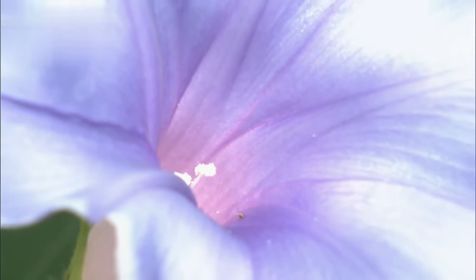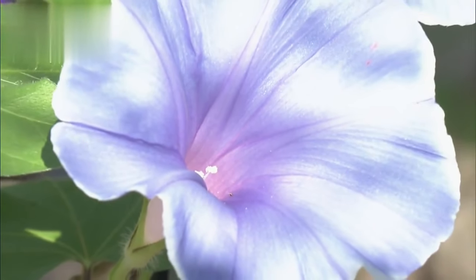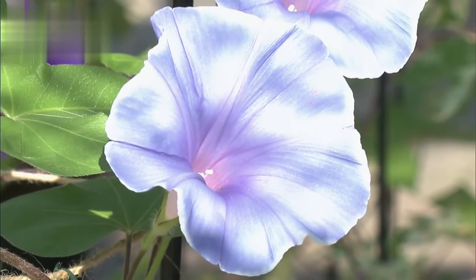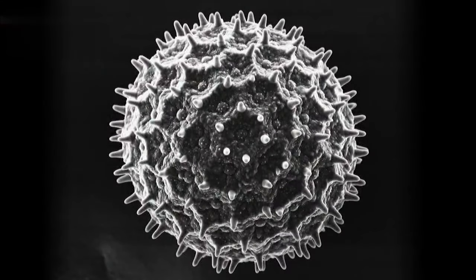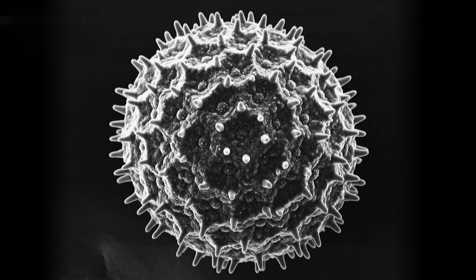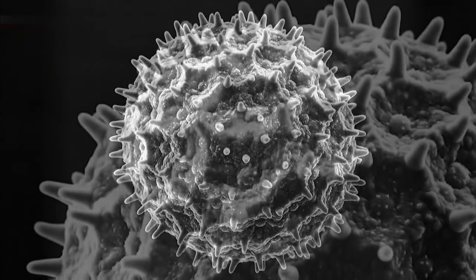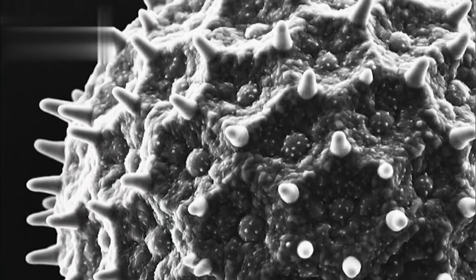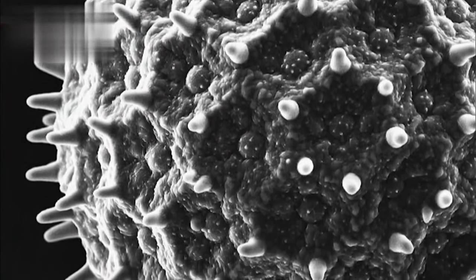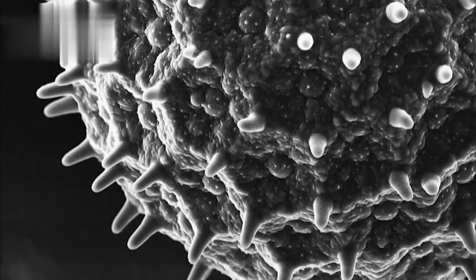Just what does it look like? Let's magnify some pollen from a Japanese morning glory. The pollen, with a diameter of about 0.1 millimeters, appears like this — every spike on the pollen and the texture of the surface is clearly visible.